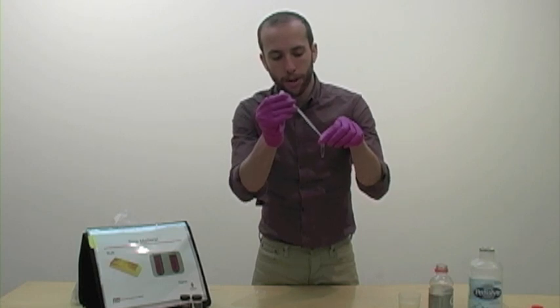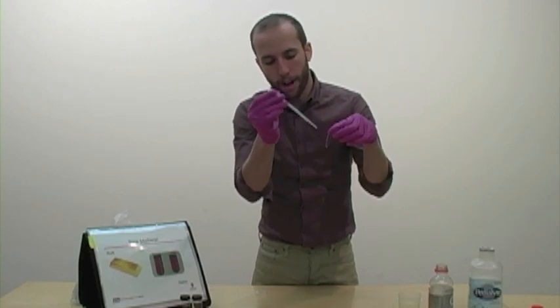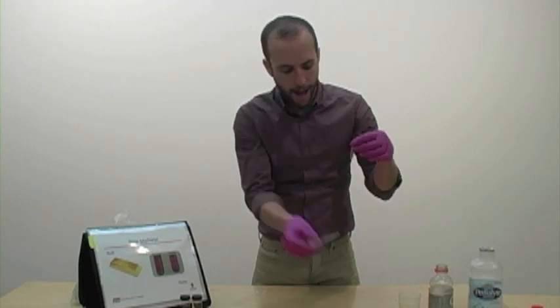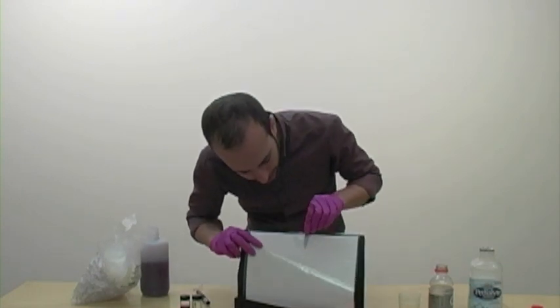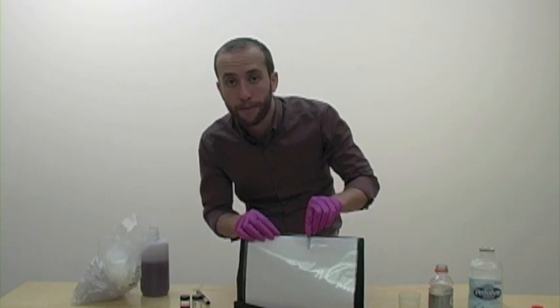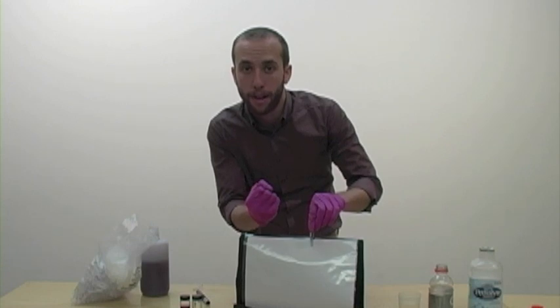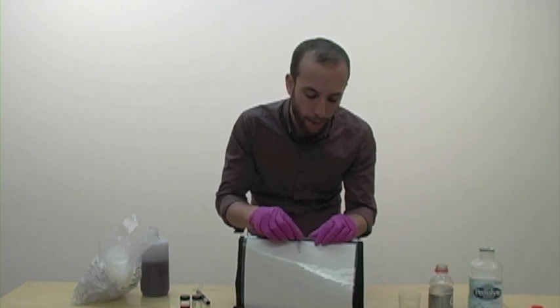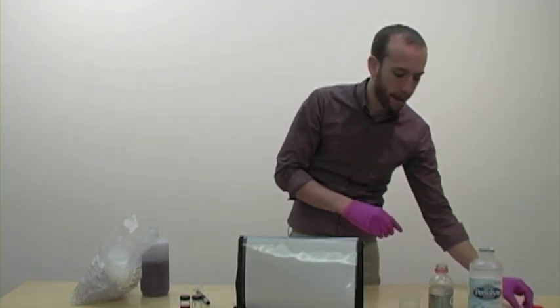One, two. So we'll just go ahead and start with ten and we'll see where we're at. Okay? So there's eight. We still haven't seen a color change. But when we add up to ten, it's going to require a white backdrop to see it more distinctly. But there, do you see that we have a nice purple color now? So this purple color indicates that all of the nanoparticles have clumped, and we can see that they are actually reflecting a different color light wave and we get purple now. Okay, so that took us about ten. I'll set that one aside.